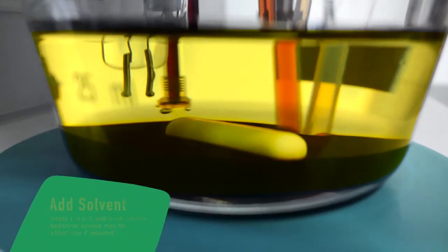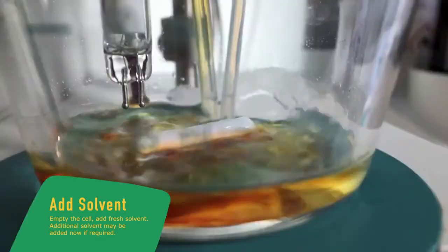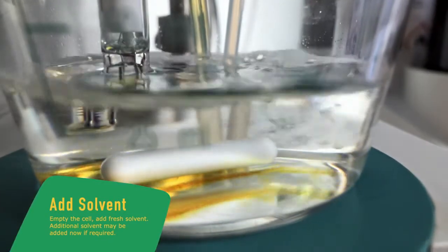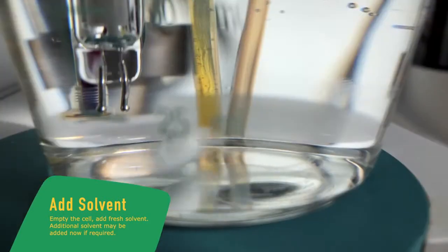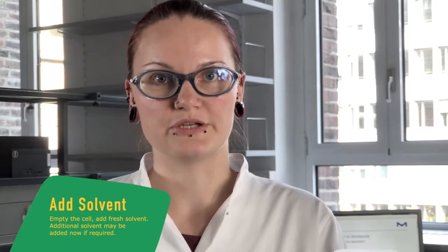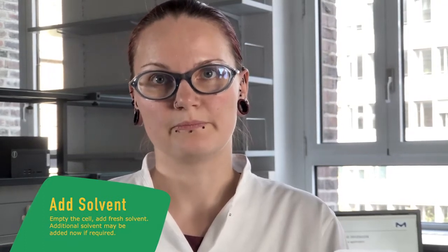And now we empty the cell and add fresh solvent. If additional solvent is needed for the determination, add it now and then perform the pre-titration in the solvent mixture.